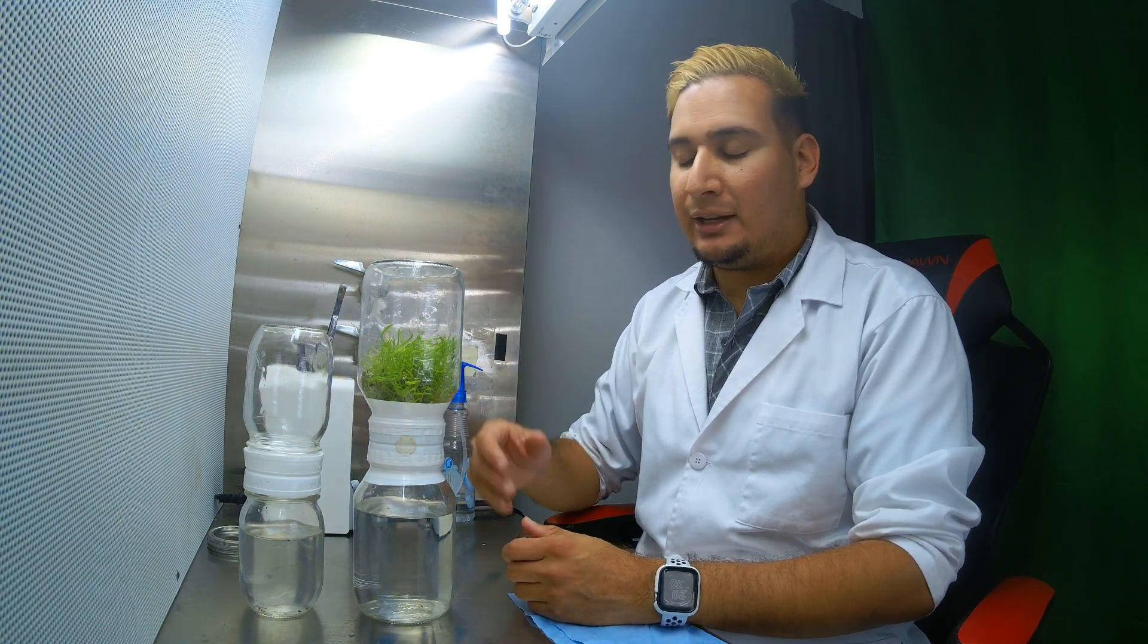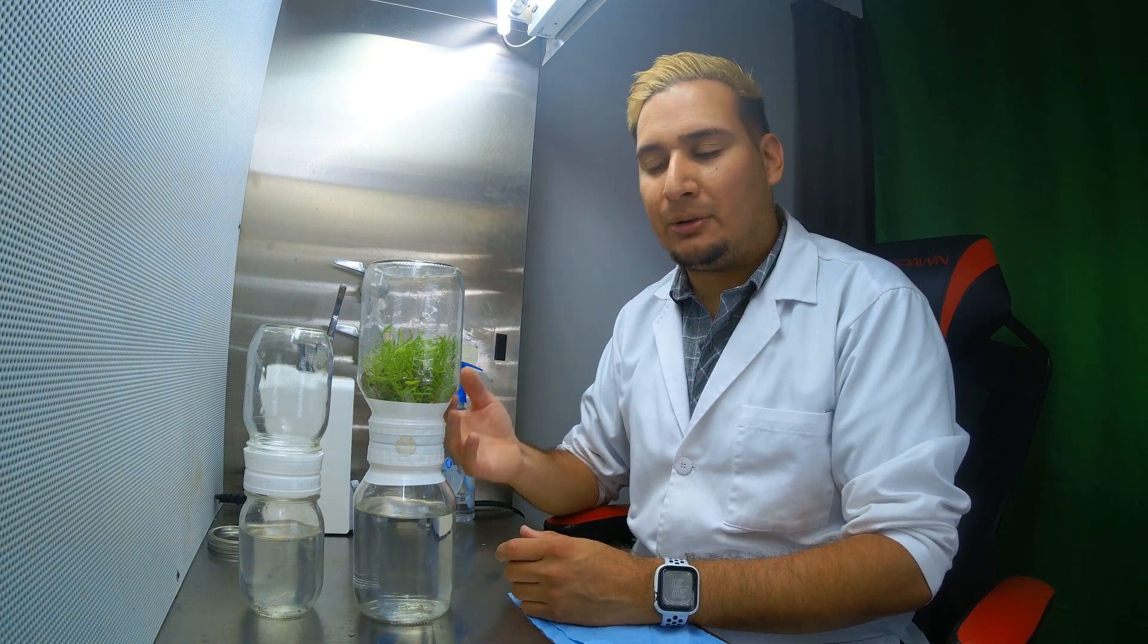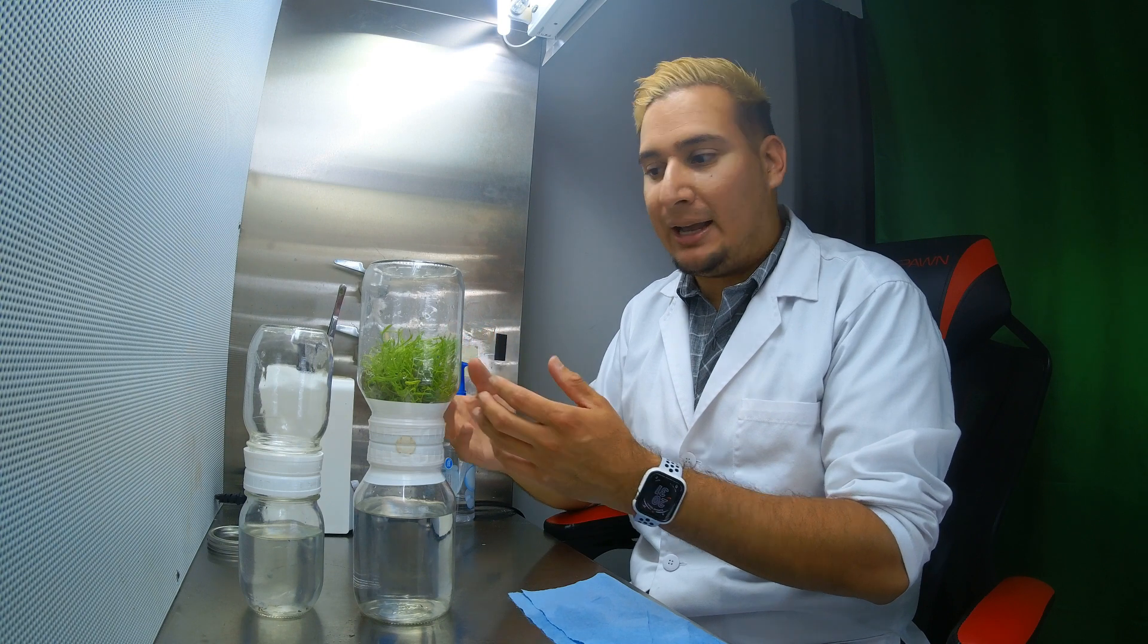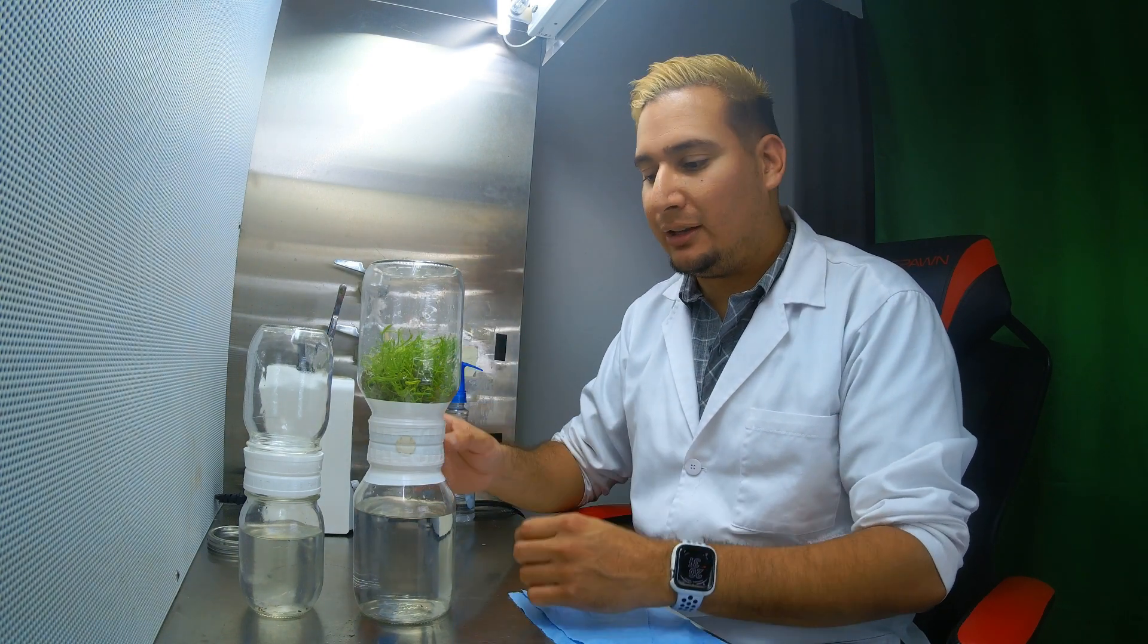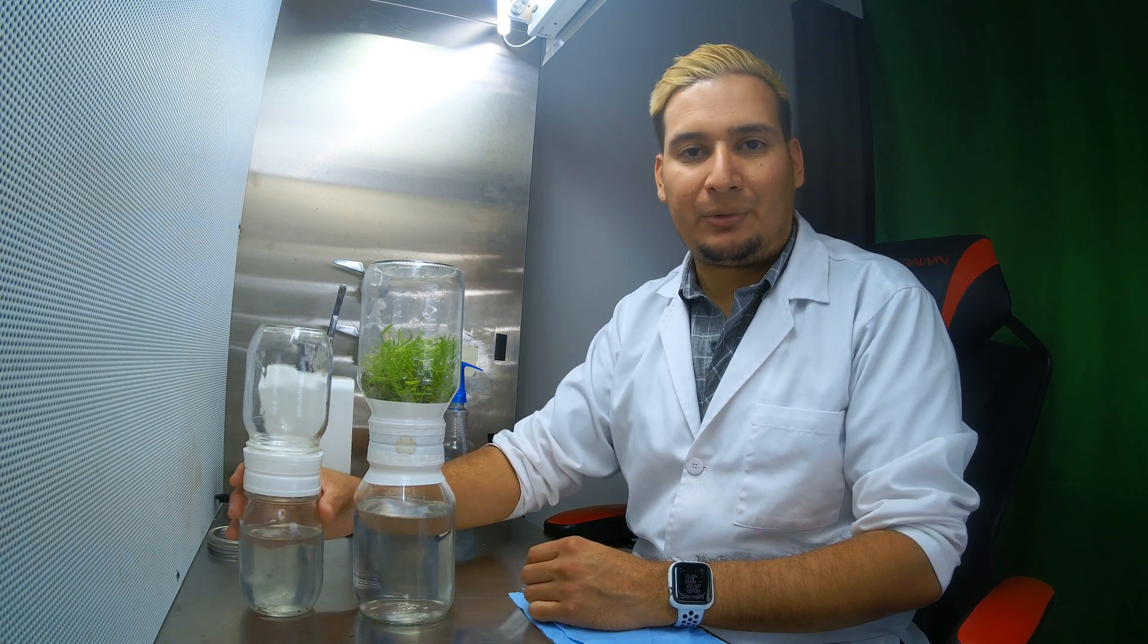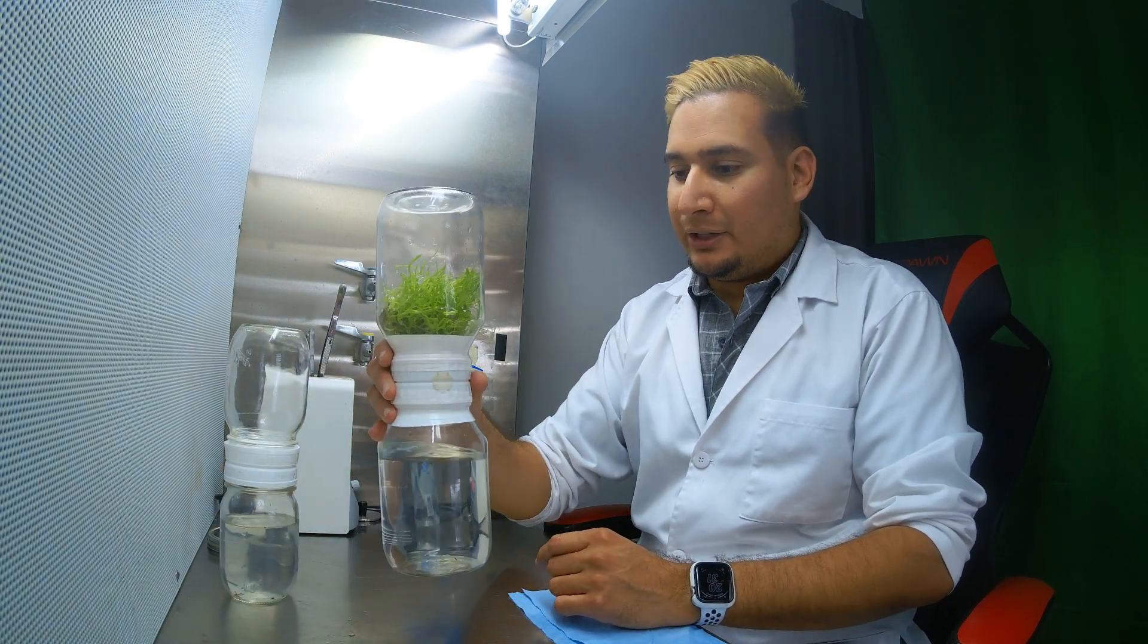I put the whole thing in here. I didn't need to put all the plants. I could just start it with a small amount and then just let it grow in the jars, but I just wanted to move the whole thing. So it looks very good.